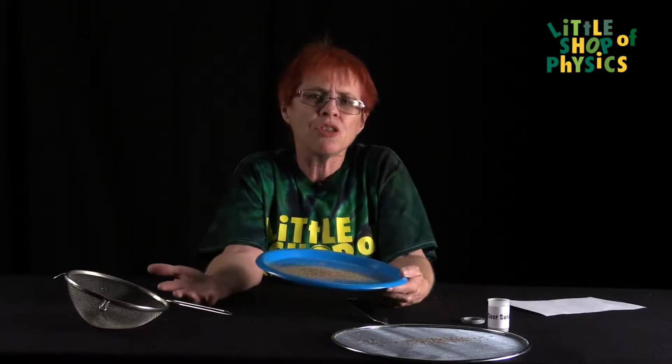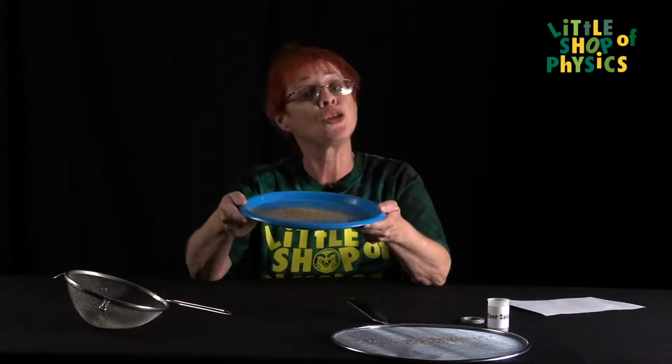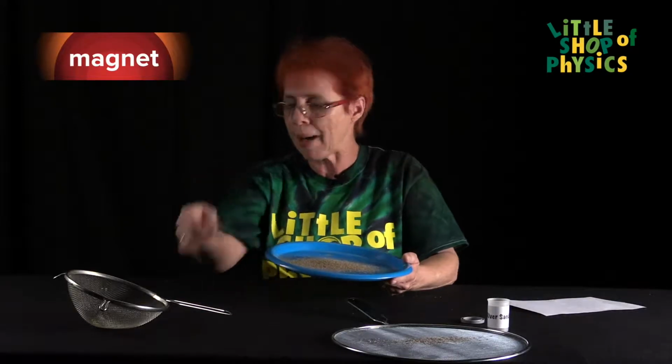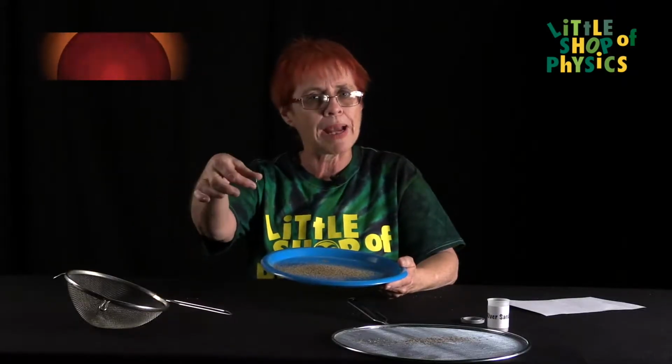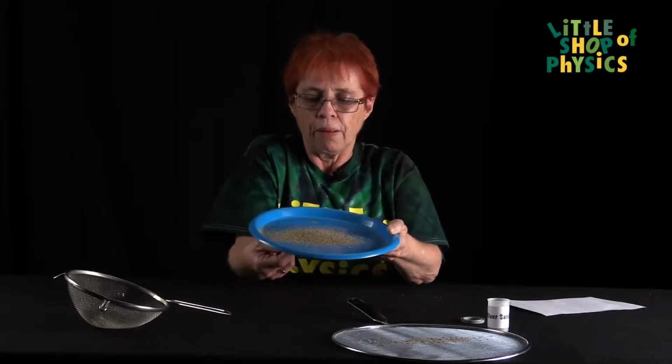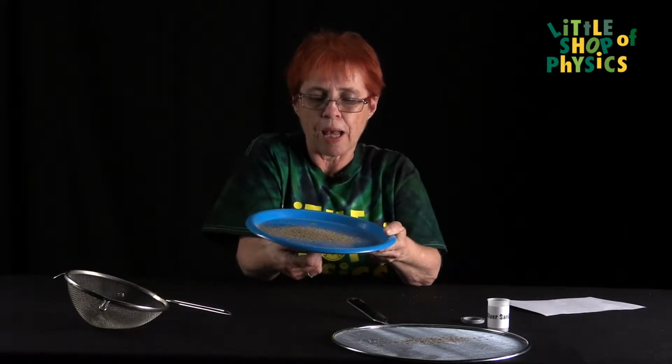But what if this is all that we can do? Let's use another property, magnetism. And this is really going to be some fun. So we have a magnet here. This is a flat magnet. You can use another type of magnet, no problem there. So we take the magnet on its flat side and just look at the magic that is happening.